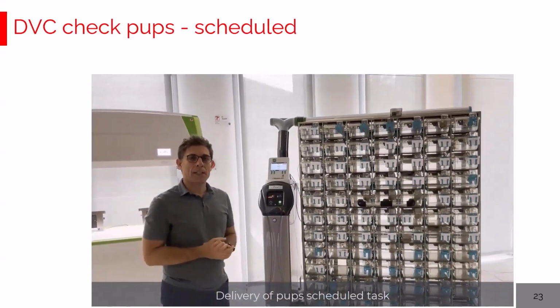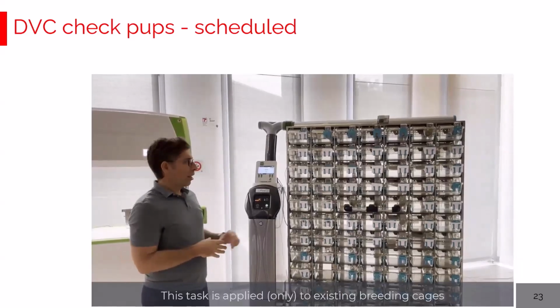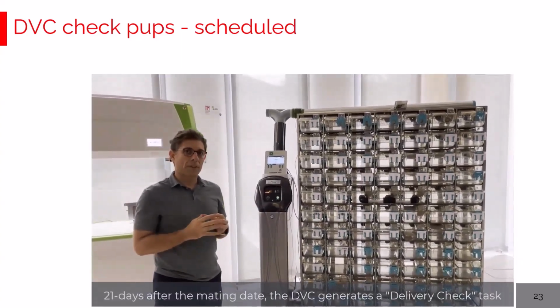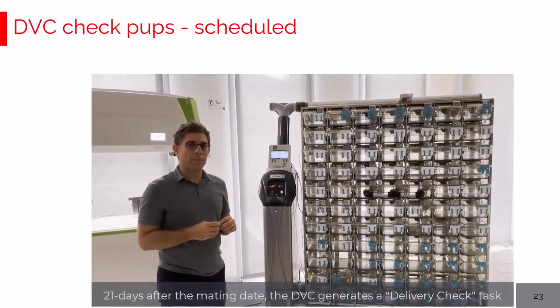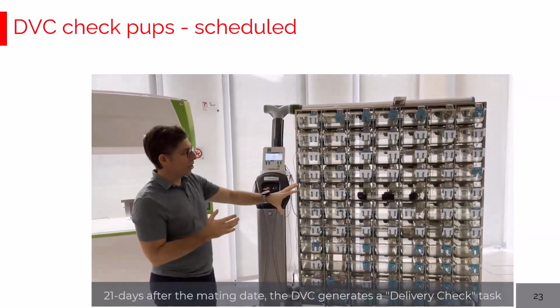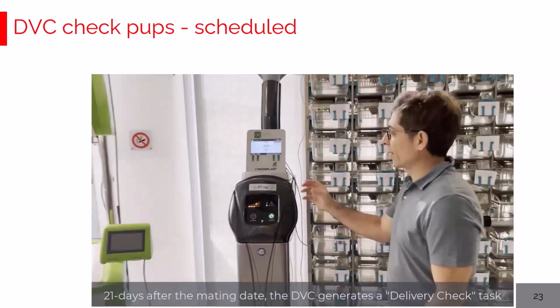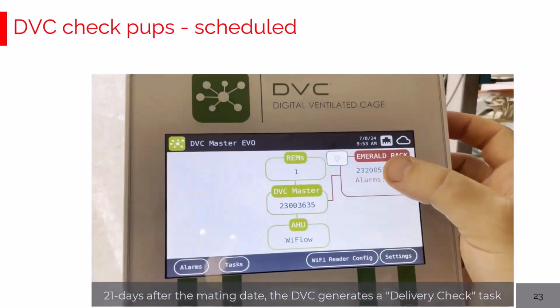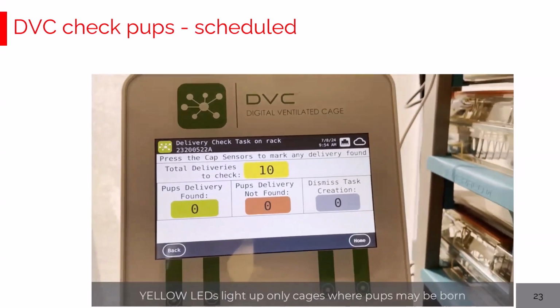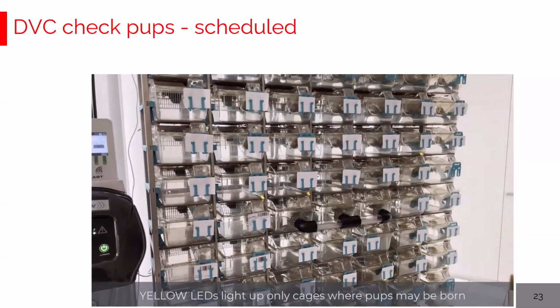In the DVC system, there is a new module designed to manage breeding cages and their tasks. In this rack, there are some breeding cages, and basically after 3 weeks after the mating date, this module can create some tasks based on a temporal window. After 3 weeks by default, some specific cages are asked to be checked for the pups. Let's have a look at these tasks. Tasks are displayed in the DVC master interface under scheduled tasks, and currently in this rack there are 10 cages illuminated in yellow, where potentially pups have arrived based on a temporal window.